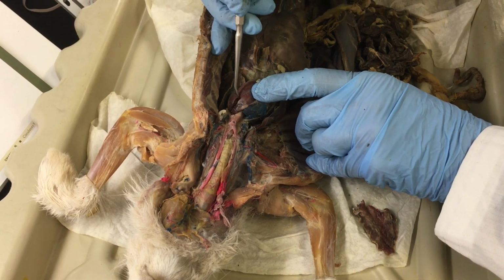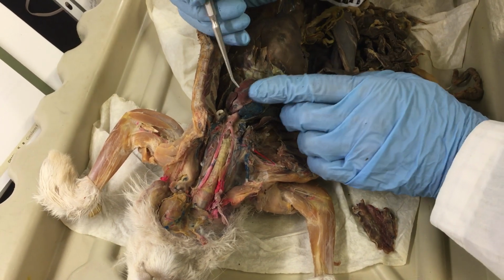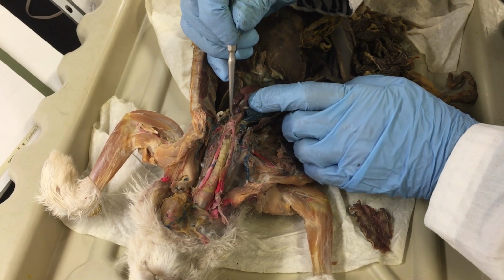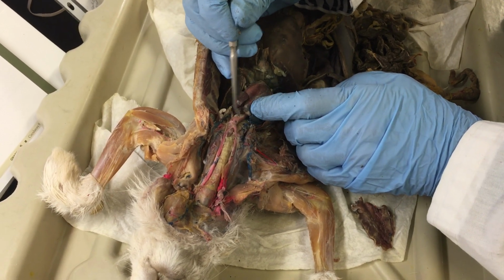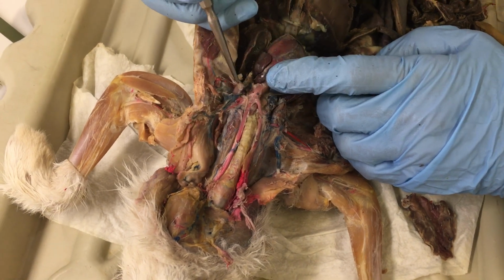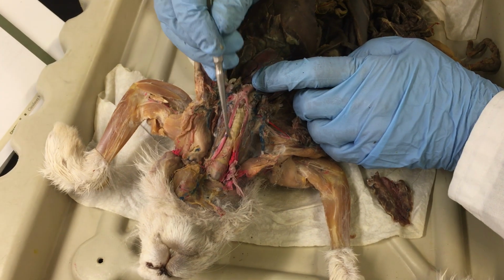Auricles meaning little ears. Okay, these are expansions of the atrium, which will be two of the chambers inside the heart. And so continuing up, we're going to see here the ascending aorta, and the arch of the aorta. And then some of the major vessels that branch out from that will be these two that you see on both sides of the trachea.